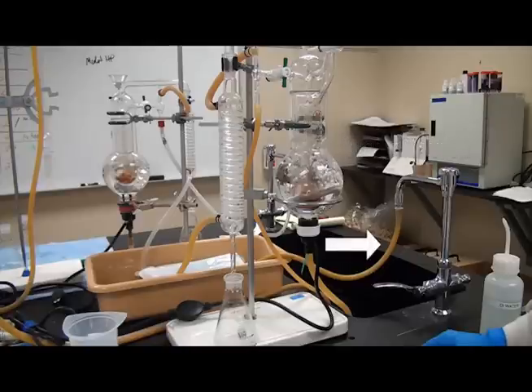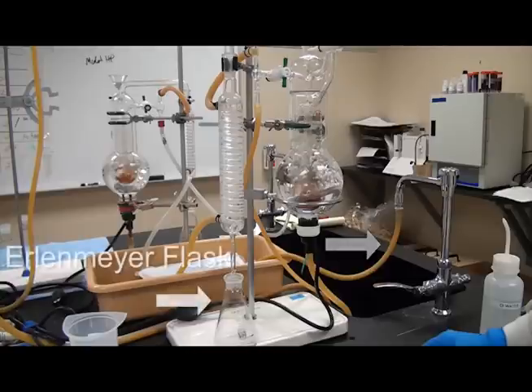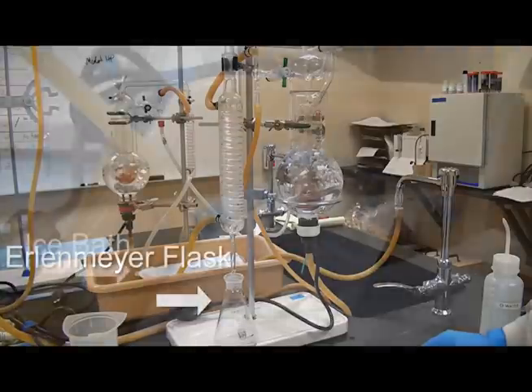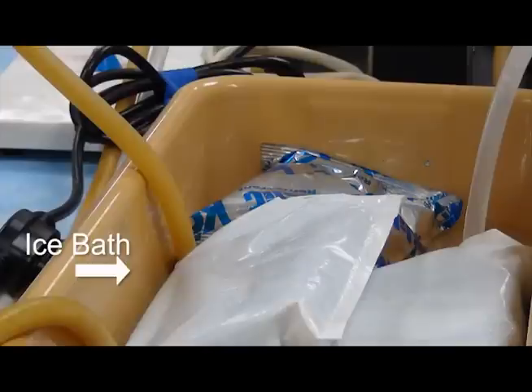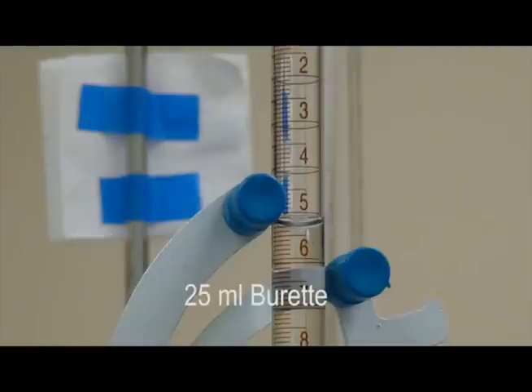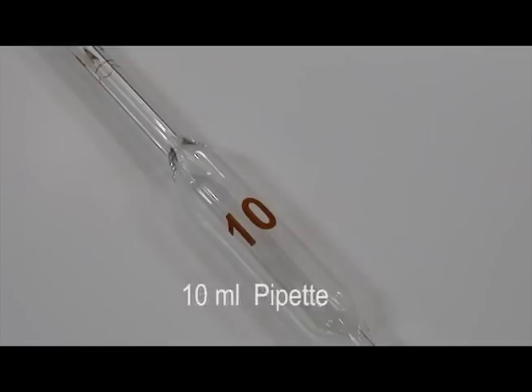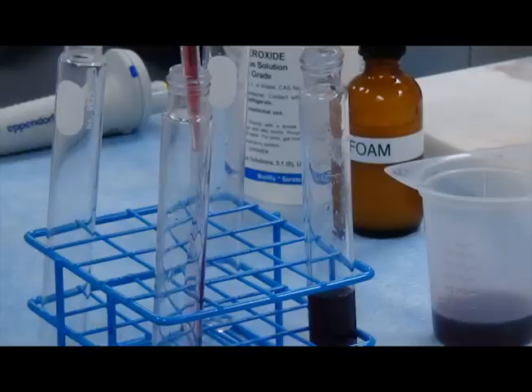Tubing to connect the still to a water source, a 150 ml Erlenmeyer flask, an ice bath for cooling the water lines, a 25 ml burette, a 10 ml volumetric pipette, a dropper, and test tubes with caps.